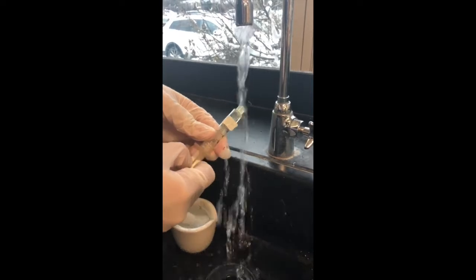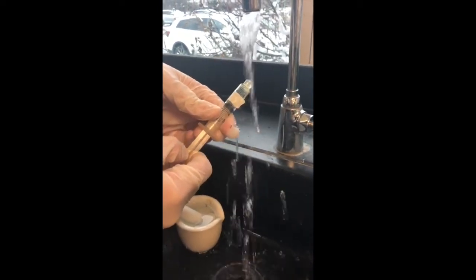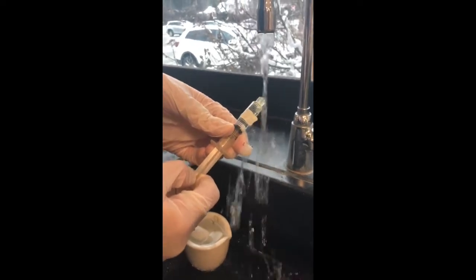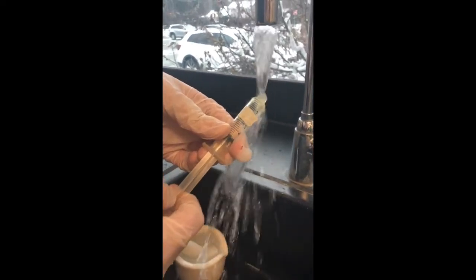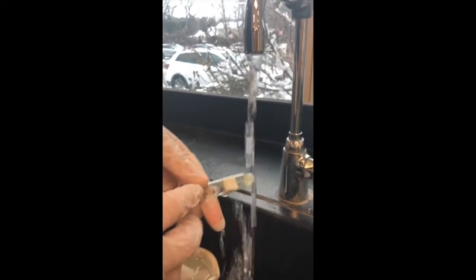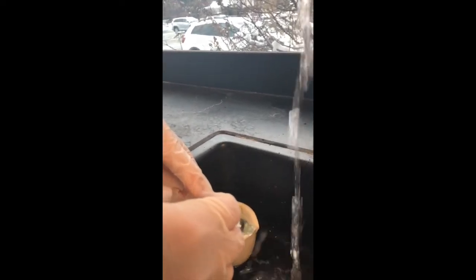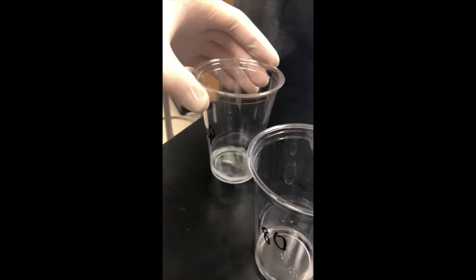After the experiment was completed and all materials had been cleaned, we then removed our gloves and aprons and began to discuss our results and the meaning of them. Our objective in this lab was to determine the impact that the enzyme catalase had on the rate at which a 1.5% H2O2 solution decomposes. In order to test that, we allowed H2O2 and catalase to react for 7 different time intervals and then determined how much H2O2 was catalyzed in each sample by performing 7 titrations.